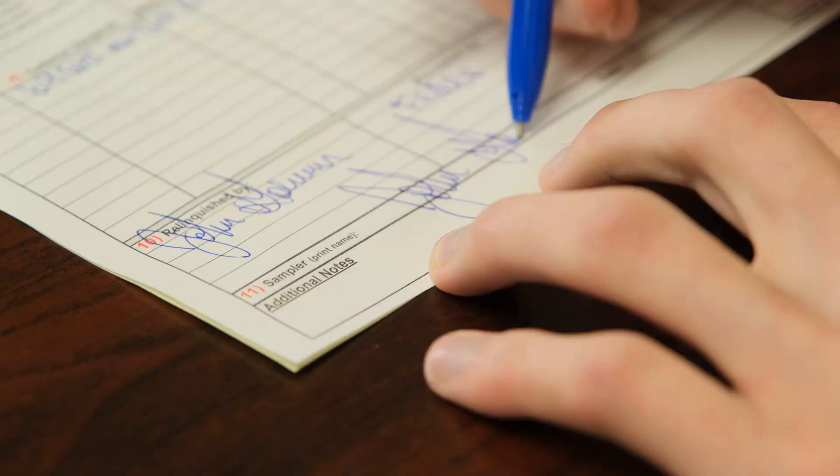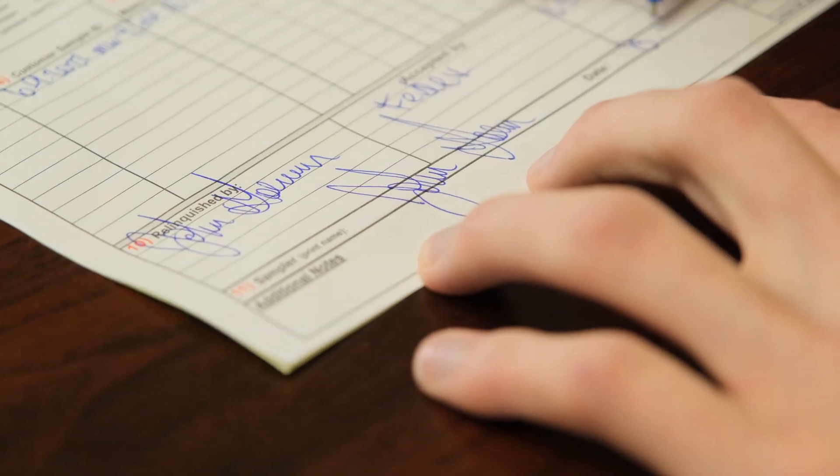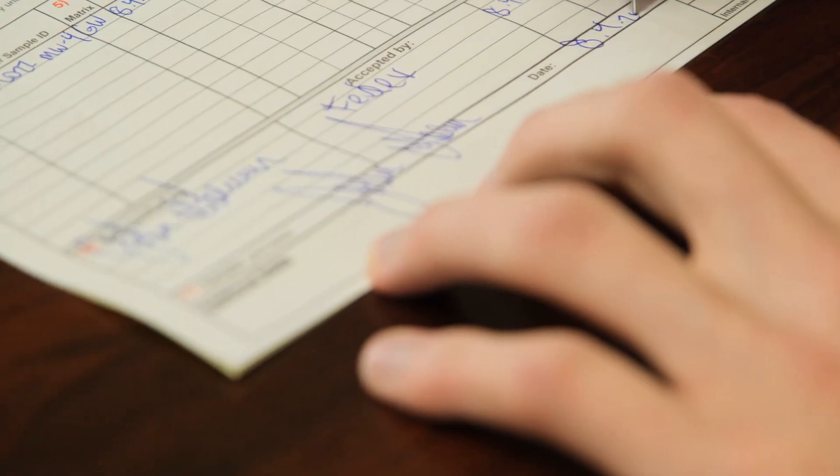And then lastly, sign your name again at the bottom saying that you're the one who in fact sampled them. Any other notes that you might have for the lab go on the very bottom. And that's it — that's how you fill out a chain of custody.